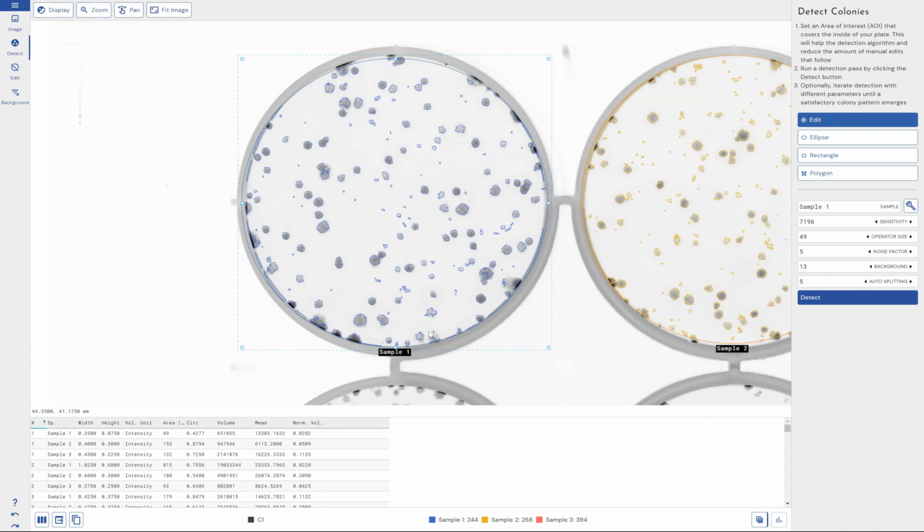See, we've changed the operator size and we've kind of missed some spots at the beginning there. The splitting section, the auto splitting tool, is basically when you've got spots that are very close together. When do we split them? When do we not? This is a good example here. But if the automatic detection isn't working too well for you, you can always override each different spot manually. And again, I will stress there are a lot of factors that we can change to really fine-tune the sensitivity of this detection. I'm just not going to do that now on this demo because it's not very interesting for the viewer to watch. So don't take this as the best that we can do.